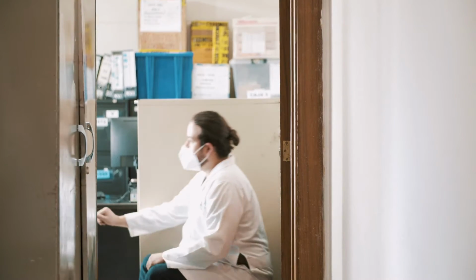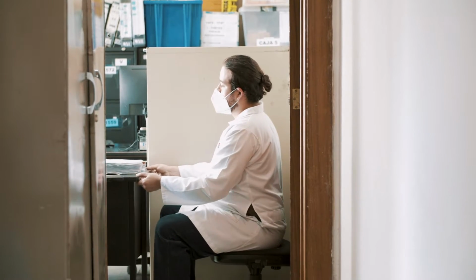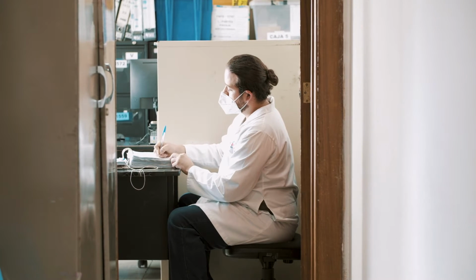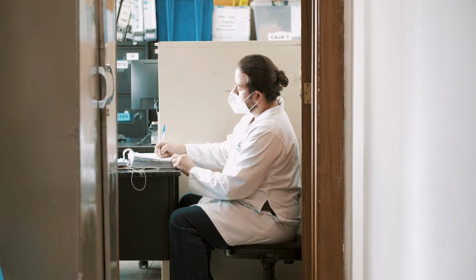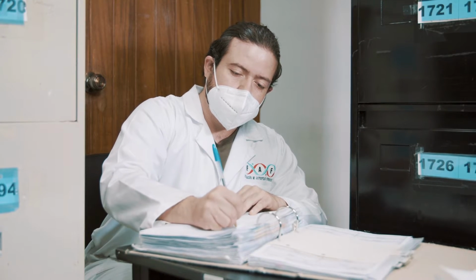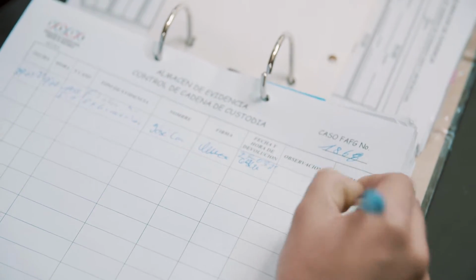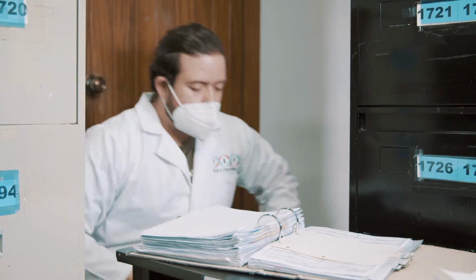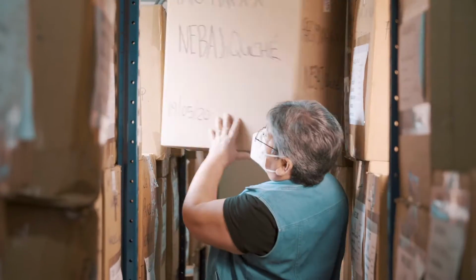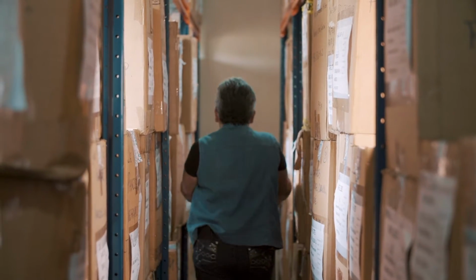In many cases, the bones may be covered with soft tissue or adhesive materials, such as grease and dirt, that hinder the process of analyzing the skeleton. The washing and labeling process refers to the procedure of cleaning and labeling both the skeletal remains and the associated artifacts. It begins by requesting the recovered skeletal remains and the exhumation file filled out in the field from the evidence warehouse, where the chain of custody of the individual remains will be filled out.